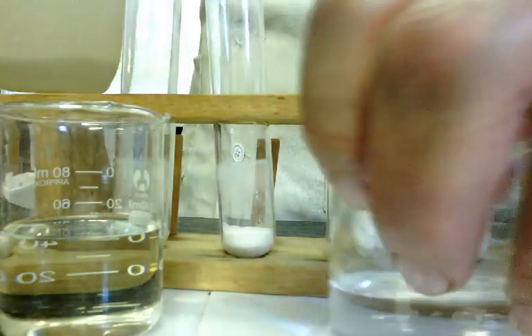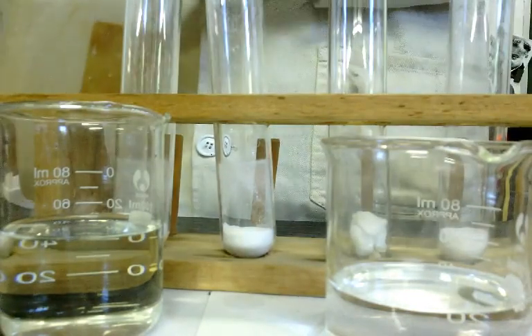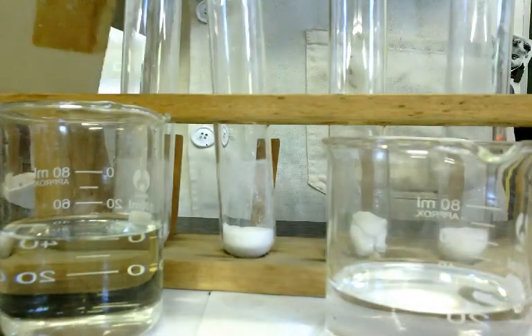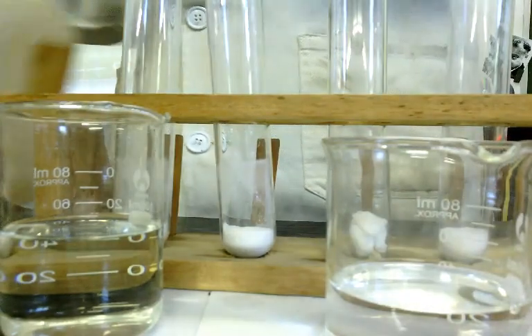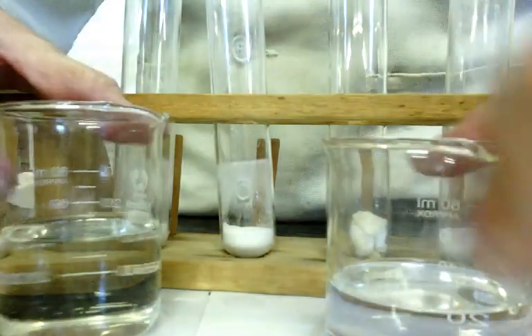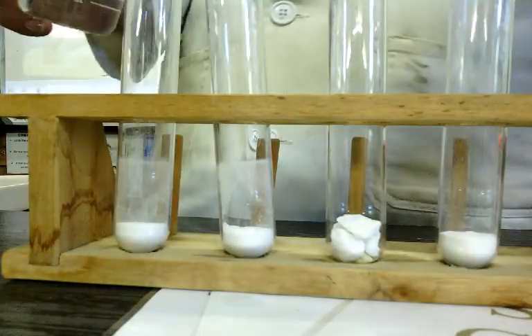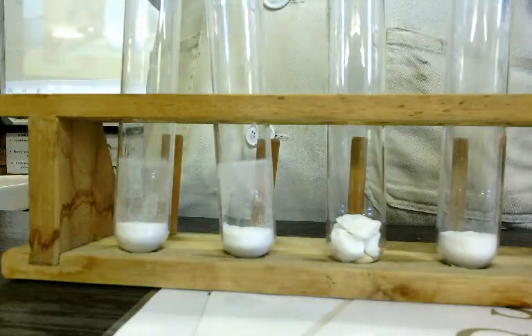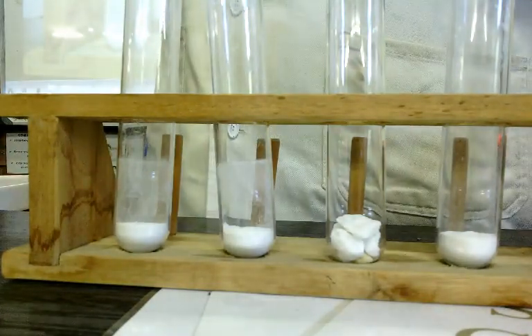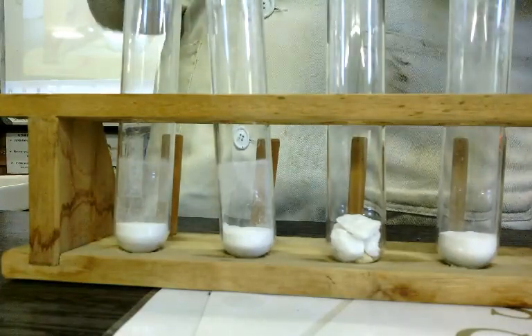Okay. So it's the same substance. This one's just got more water mixed with the HCl. Okay. This could be a bit messy. Okay. So let's see. So which factor are we investigating here? The concentration of the reagent.